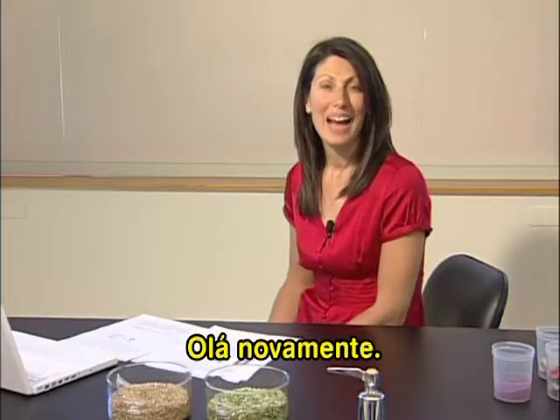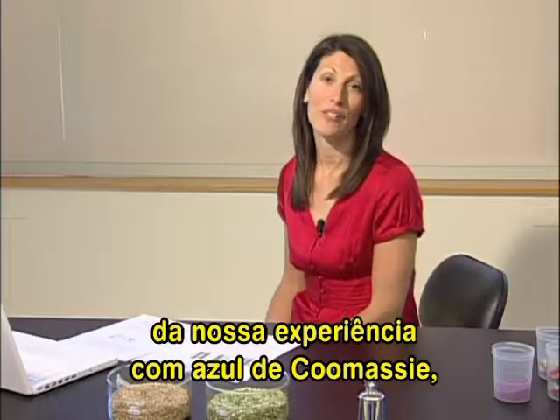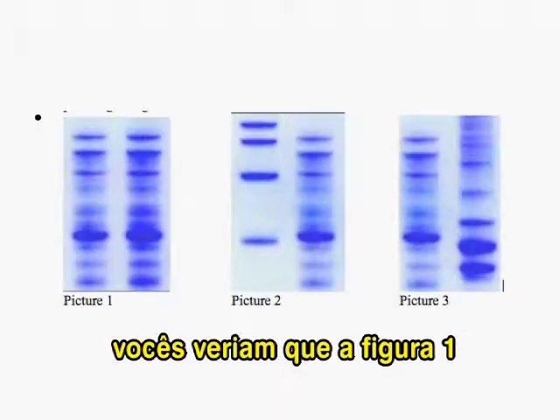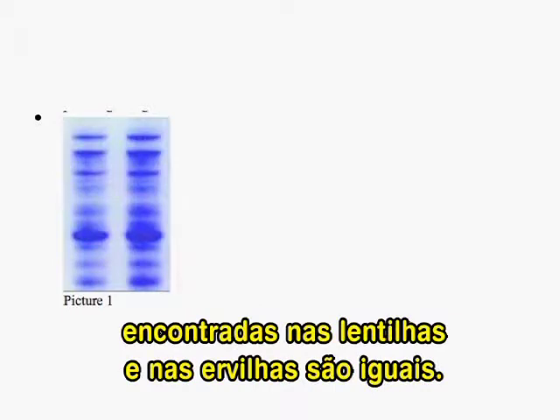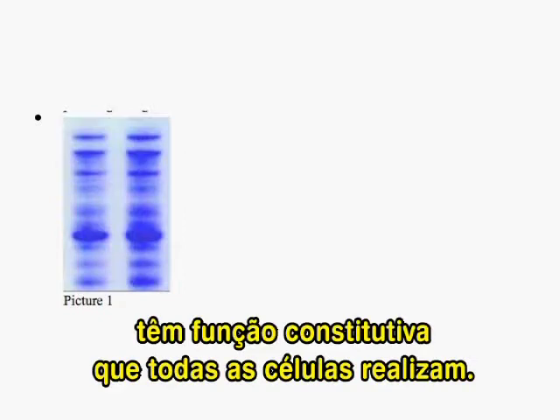Hello again. I don't know which of the pictures you thought was most likely to be the result of our Coomassie staining experiment, but in fact, if you were here in my lab and ran this experiment, you would see that picture 1 is closest to the result you would find for the 2 protein profiles. That's because most of the proteins in the lentils and in the green peas are the same. Most proteins in the cell have housekeeping functions that all cells have to carry out.